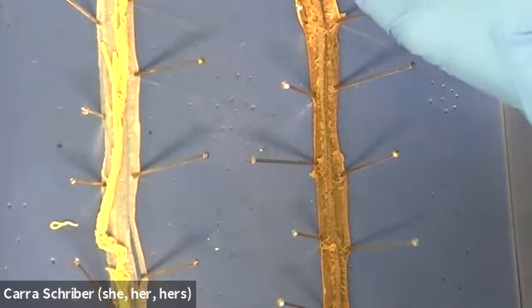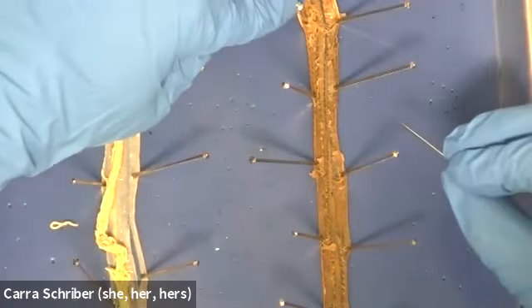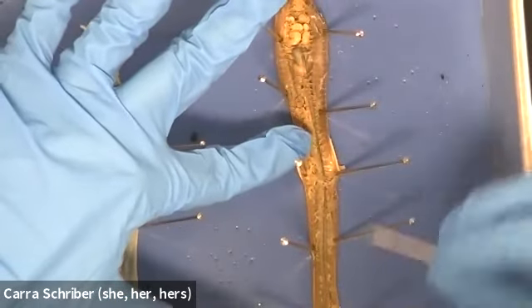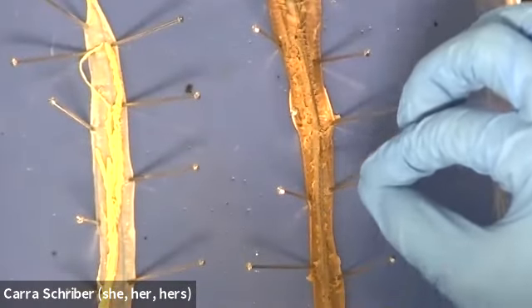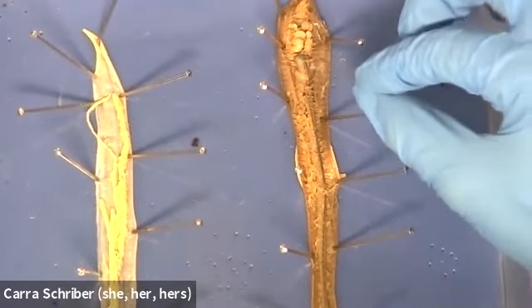And so it's just like a perfect line. So you can see how on this side, the line is a little bit shifted to this side, right? And then it evens out and it's kind of right in the middle of this part. So that dark line is the line of the dorsal blood vessel, all right?